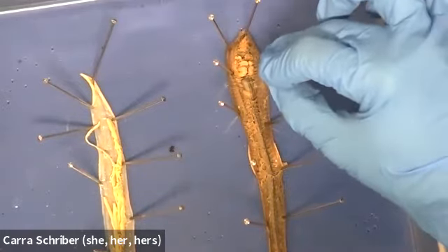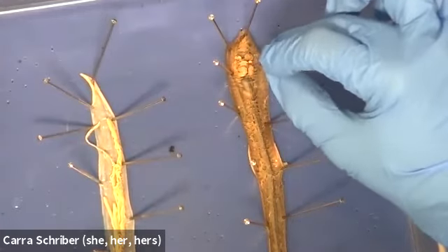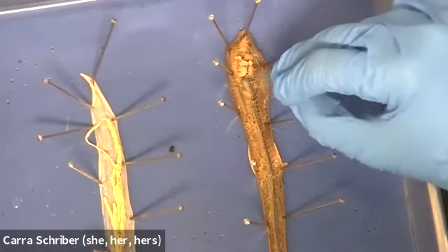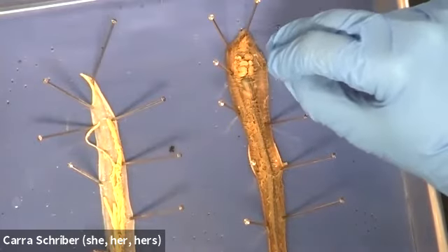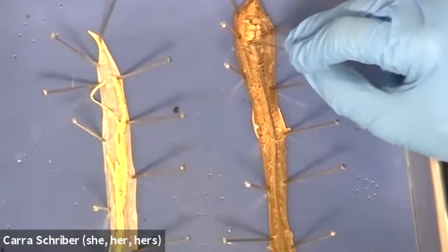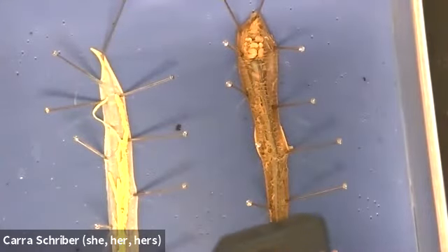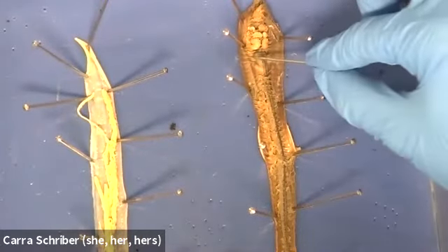These white globs are actually going to be the seminal vesicles. That's not part of the digestive system, and I don't want you to concern yourself with what it is. But the important part is that they are on top of a certain length of this pharynx. So the pharynx is going underneath these seminal vesicles. And then the next thing that I want you to notice is we have this change where we have a globular, or kind of swollen part of this, and this is the next organ here.